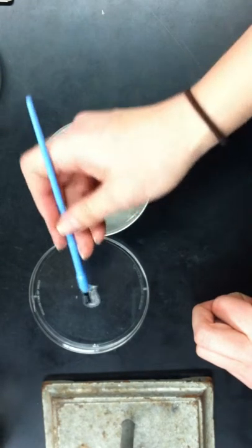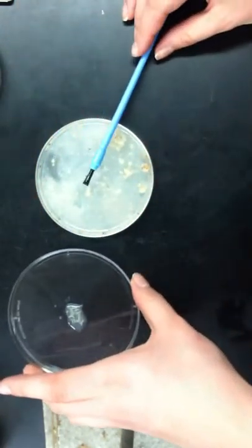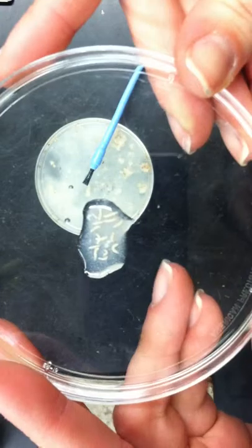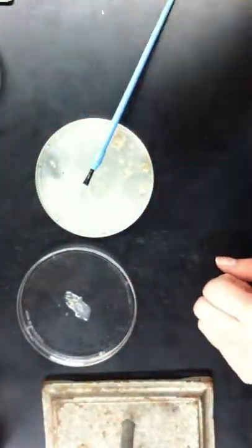And then after a while, here's probably only like 10 or so, 15. After a while, they kind of sit in this pool. And here are the larvae you're going to use, and then you transfer them to your training plate to begin training and testing. Thank you.